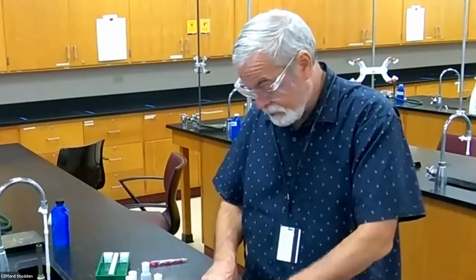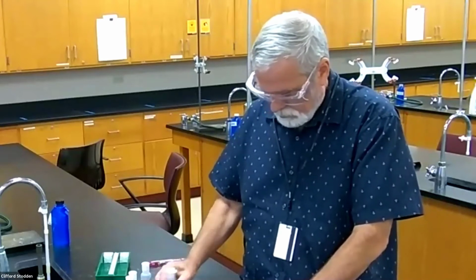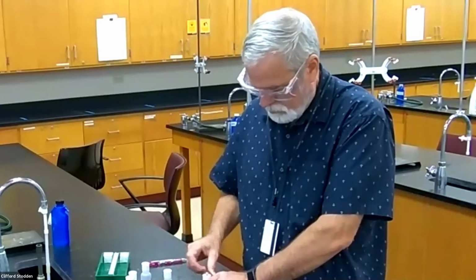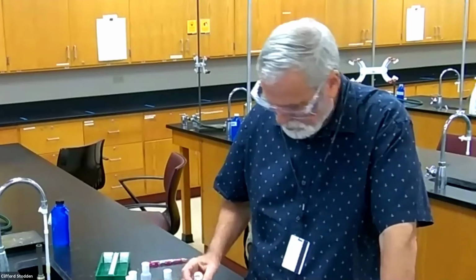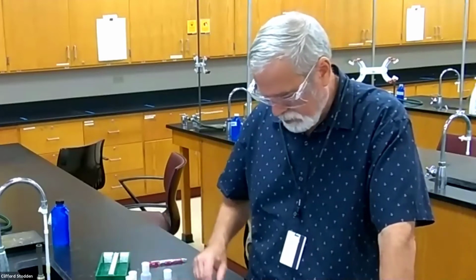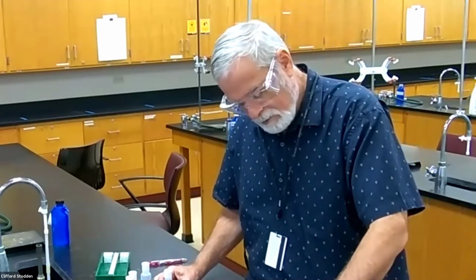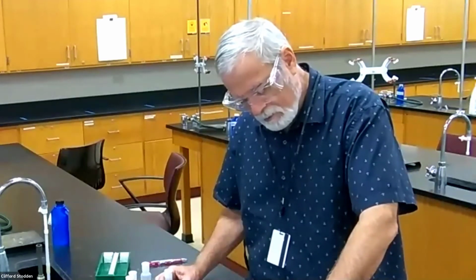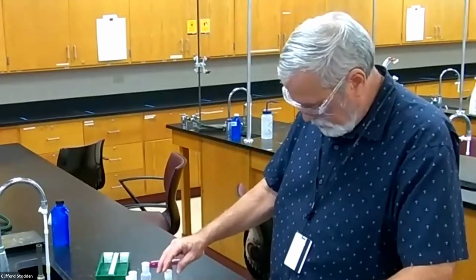The next one is silver, so I would expect something to happen with the silver on this one. The silver chloride is insoluble, I know that. You're adding silver to this, and it's really, really heavy, milky white, which I'll show you in a minute. Then the next one after that is sulfuric acid, barium chloride with sulfuric acid. If it did precipitate, that would be barium sulfate. Let's try that one.